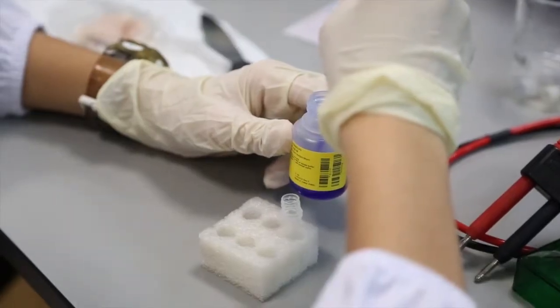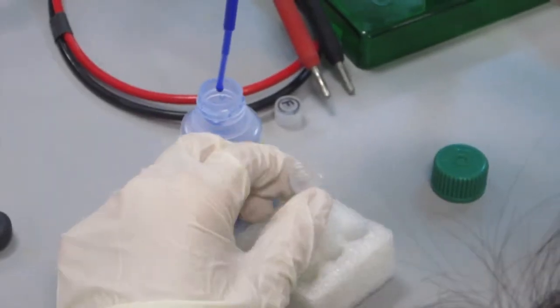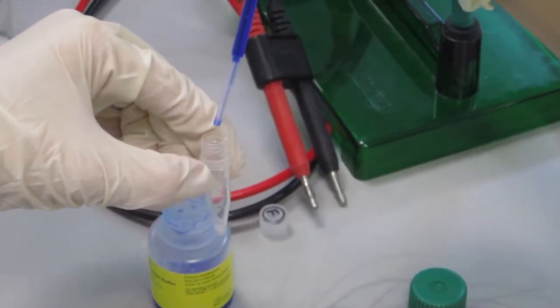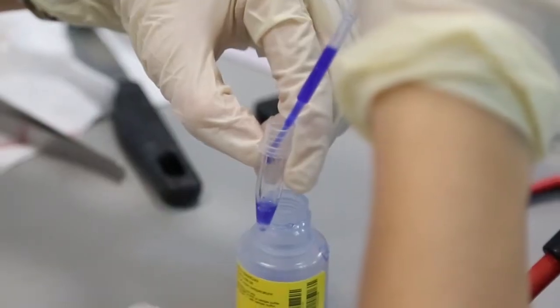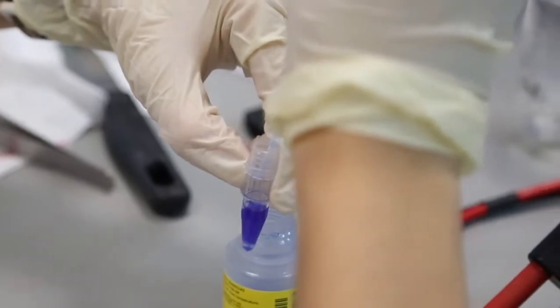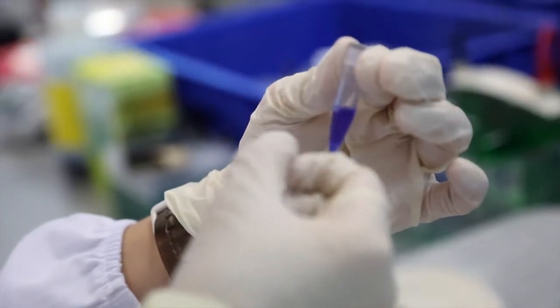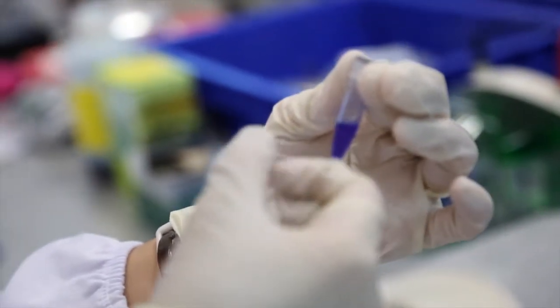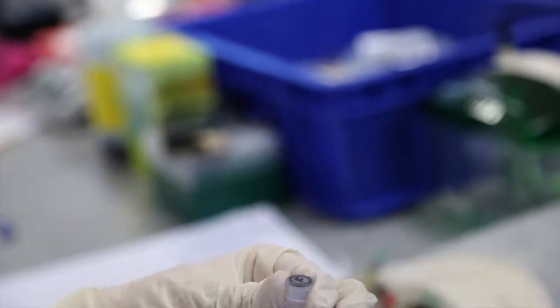Step 2: 250 microliters of sodium dodecyl sulfate and beta-mercaptoethanol buffer was added to the microtube containing the sample. Then flick the microtube 15 times with your finger to agitate the tissue in the sample buffer.